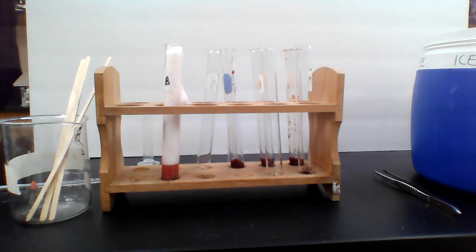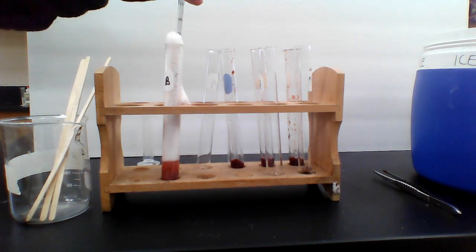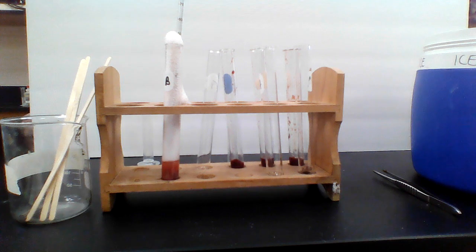All right, so let's make sure we're clear on that. So for the crushed liver, we have a 10 on that one. We would say the temperature, I forgot to do the temperature change. Let's get that. For this one, we would say a yes for the splint test. It was definitely a positive test for the splint test. And then we're waiting on the temperature right now. We'll give that just a moment. While I'm waiting on the temperature, maybe I'll tell you about the next one.